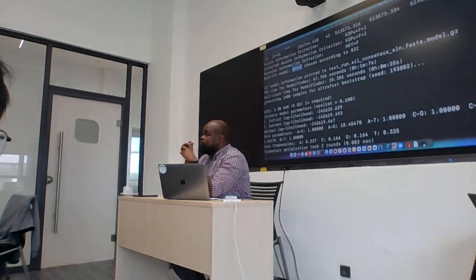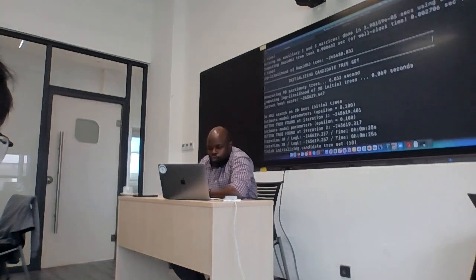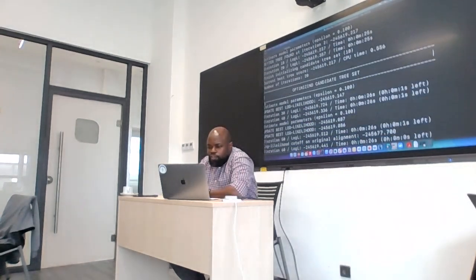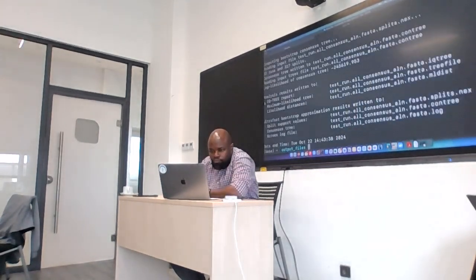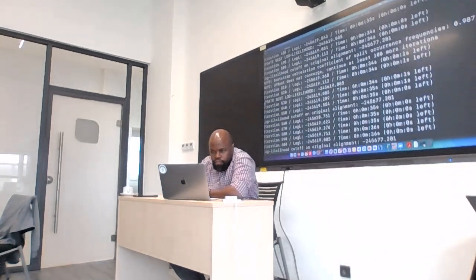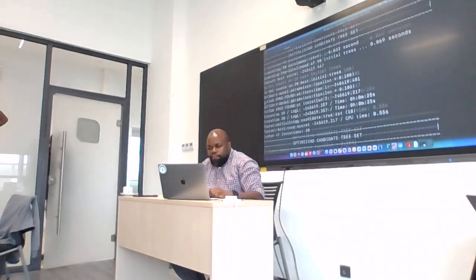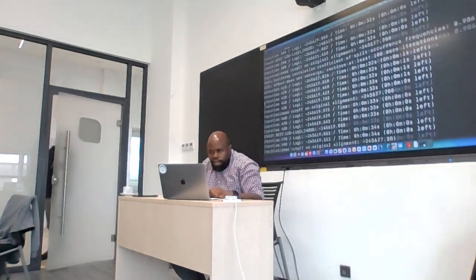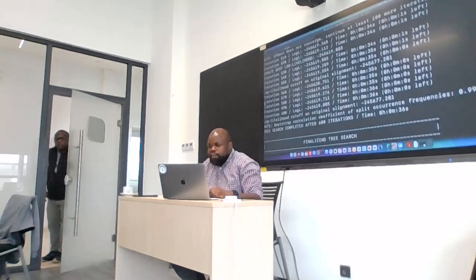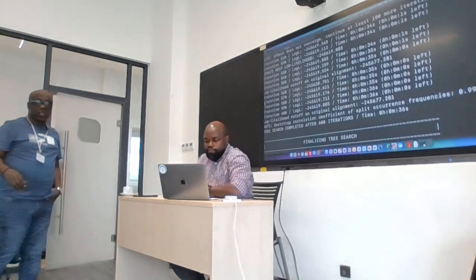This model. Yes. Based on it. And the best model is. Yes. Good. So then we generated the tree, and you can see that the tree search went through different bootstraps, and when it got to around 600, there was no further improvement. Okay? And then it stopped.